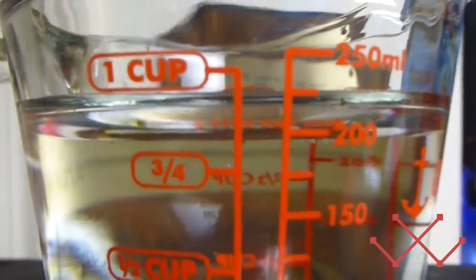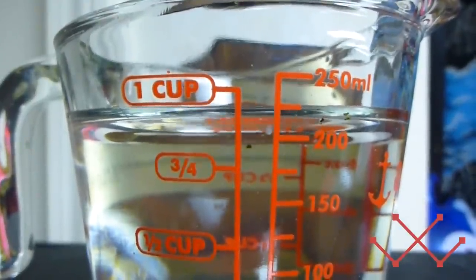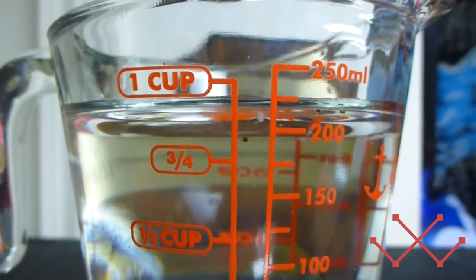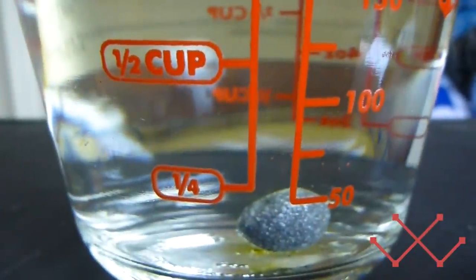Now, this little film that I've created, on the surface of the water, will stay on top, and it will trap the vapors pretty well. Sorry, my camera doesn't like to focus on water. So, this will trap in the vapors, and it's clear, but it won't interfere with the experiment.